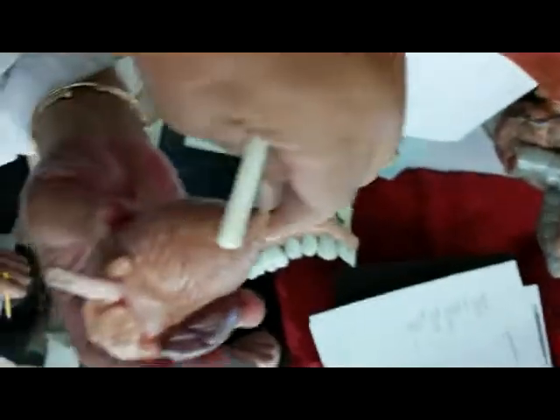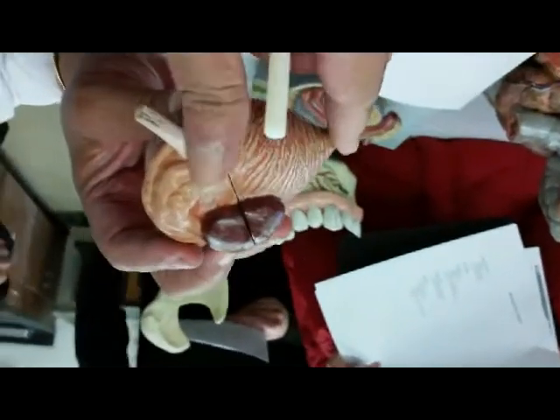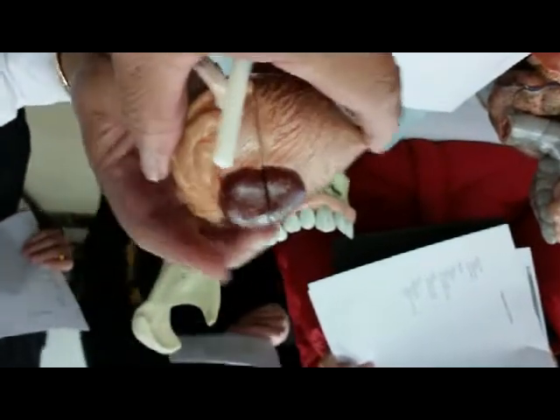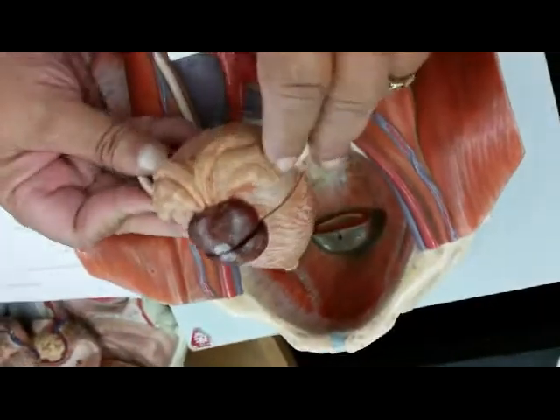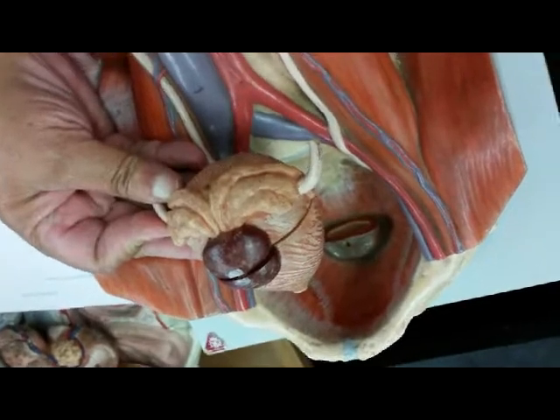And this 1 tube that leaks out the urine is called what? Urethra. U-R-E-T-H-R-A. Urethra. This happens to be male. This is a male model. Why is this a male model? It has some features there that belong to the male only.